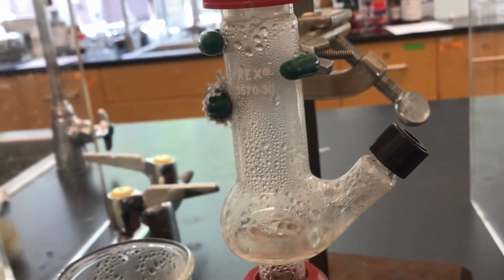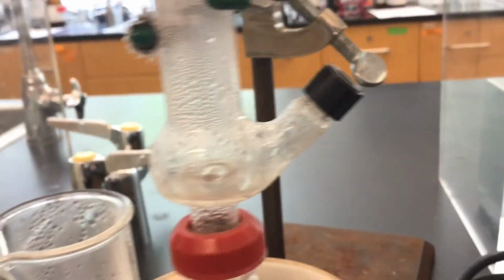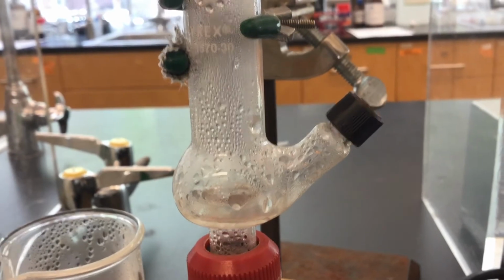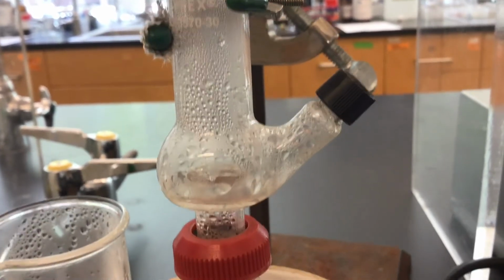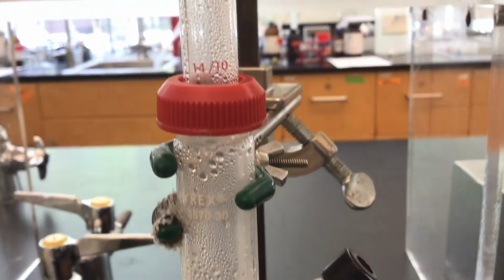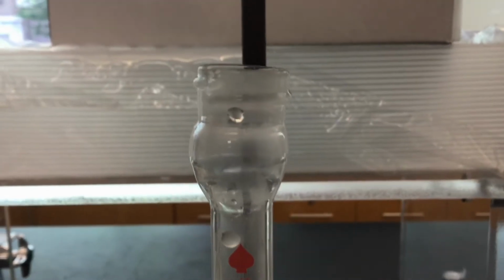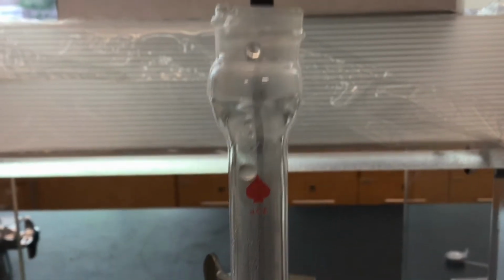So we're going to let that build up every time that we unscrew the cap here, and wait for it. All right, so you can see that coming down, that just dropped into there. That's the distillate, and it's condensing all the way up to this air condenser. It hasn't left just yet.